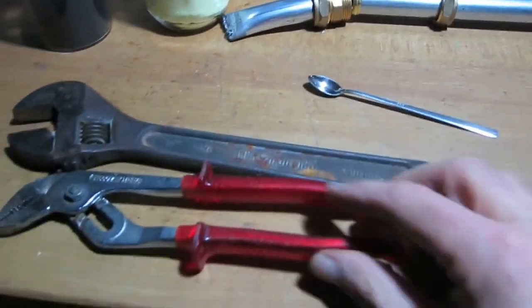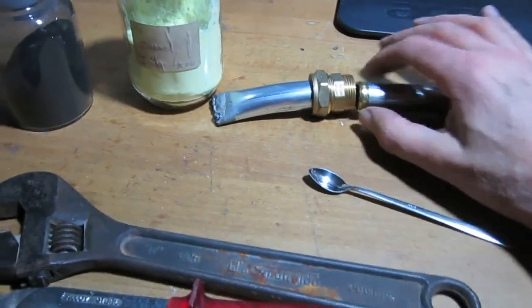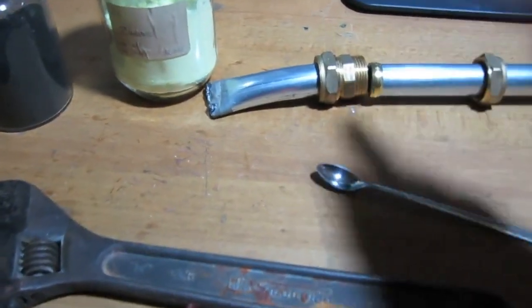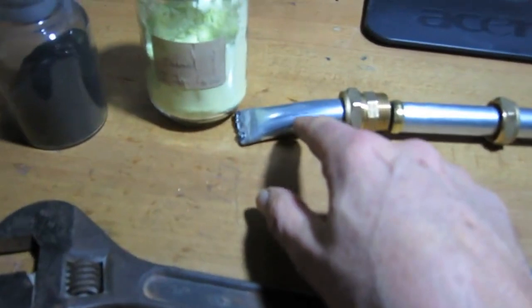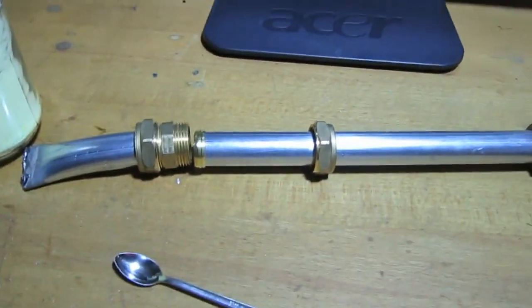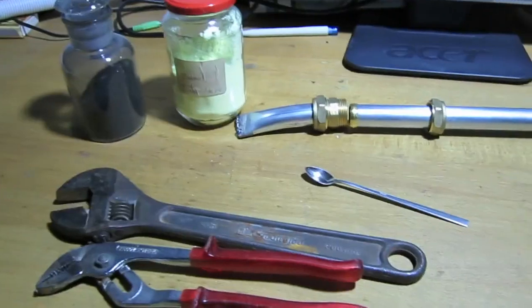I will couple this to this one with this plumbing equipment. It's just a clamp coupling where these brass rings clamp towards the other tube, and this can resist, I think, 600 degrees. So I only heat this part, and then that's all. And this is the tube. It will cool down, and the CS2 should just enter into a test tube. So that's what is going to happen.